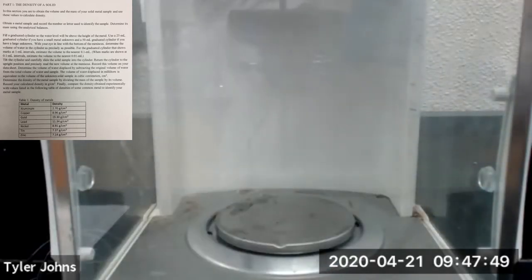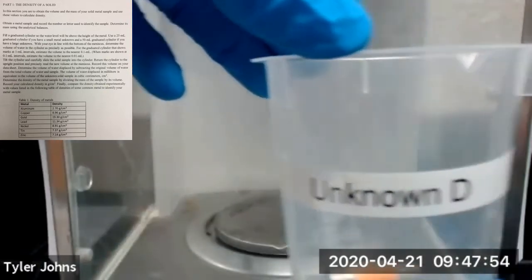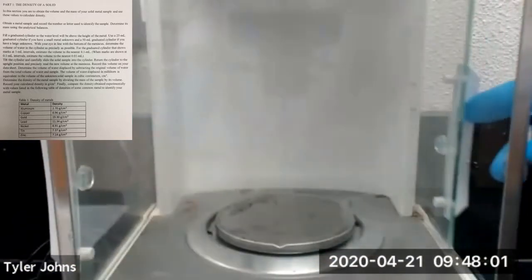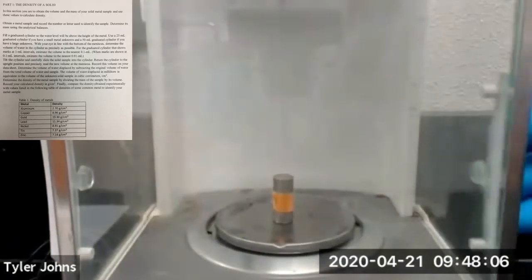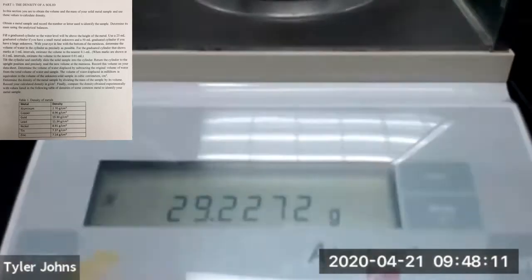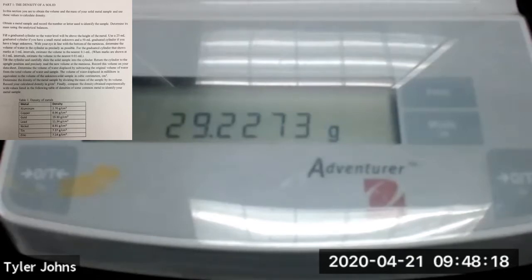Now we're going to determine the mass of unknown metal cylinder D. This is unknown D. The mass of unknown metal cylinder D is 29.2273 grams.